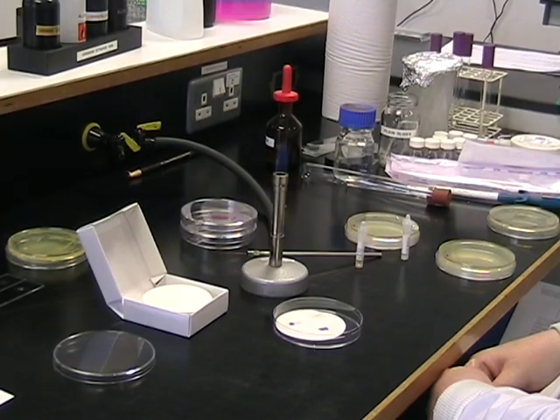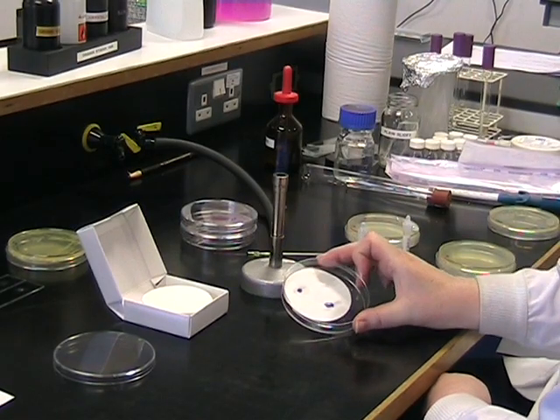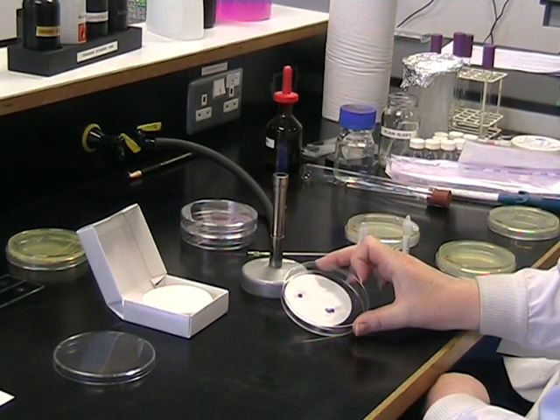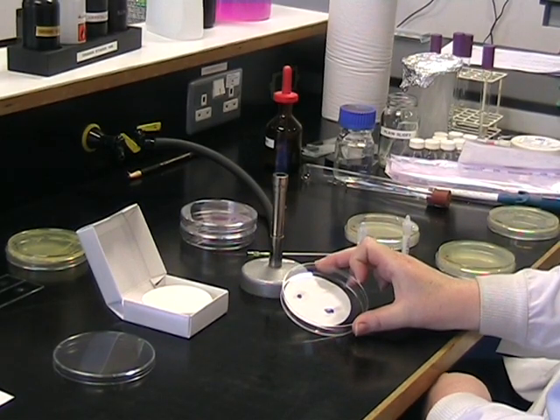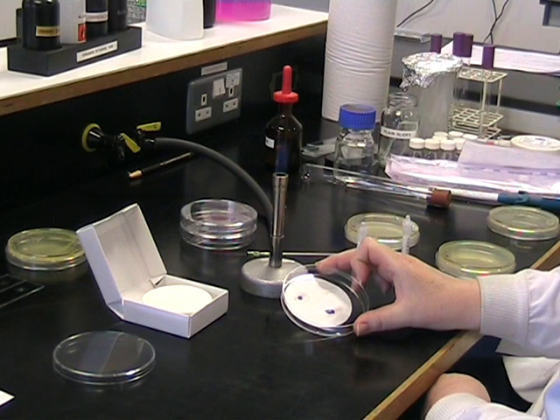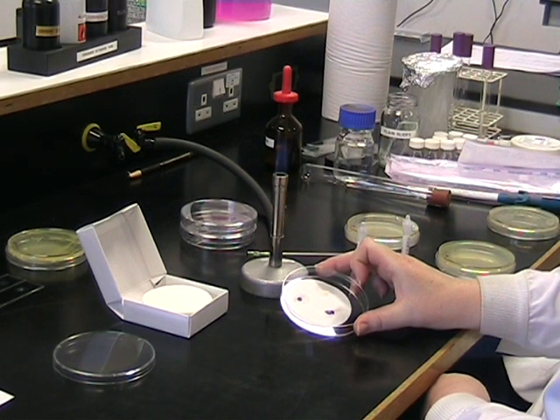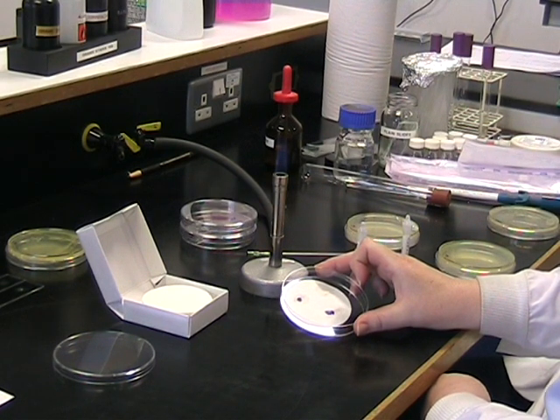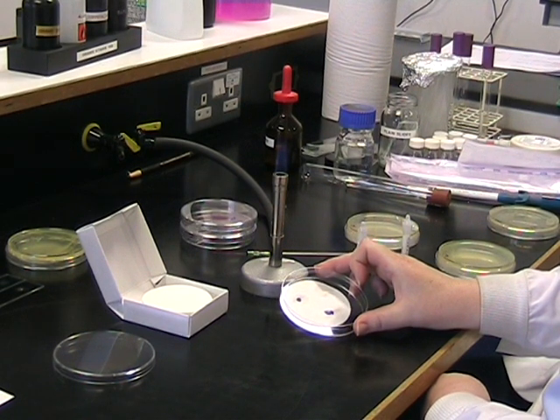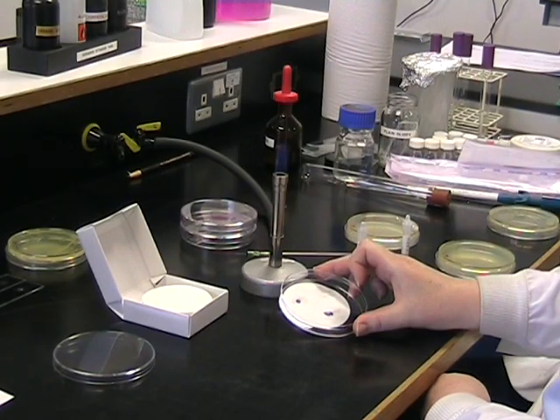It is essential to remember that the plate you have used for these tests is contaminated with live bacteria. You must therefore dispose of it correctly. Make sure you place it in the discard tins provided.